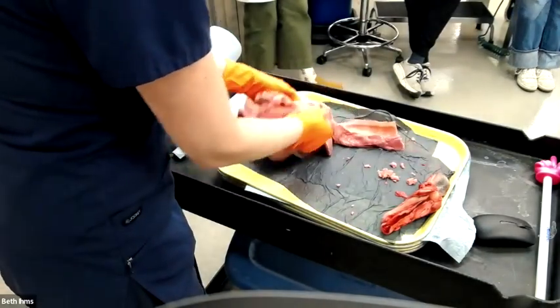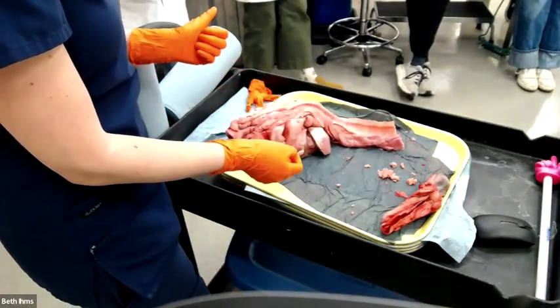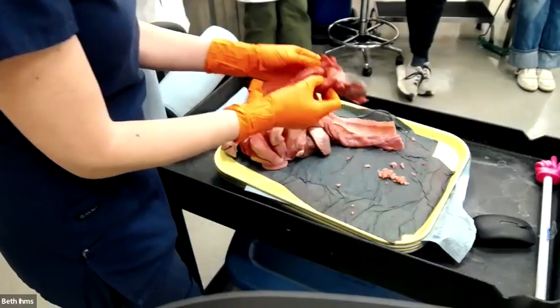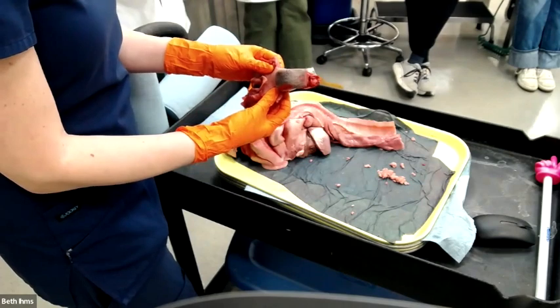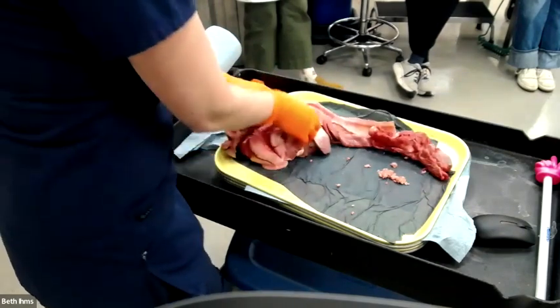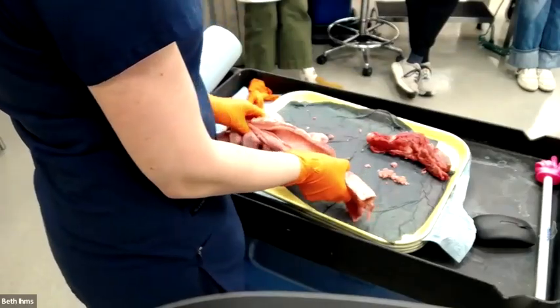All right, we have 2 specimens here. This was a sheep or goat. I don't know, it's some small ruminant. Did everyone see the melanosis on the tongue? Yes. Easy. Done. All right. Did everyone find the lesion on the pluck? A little more difficult.